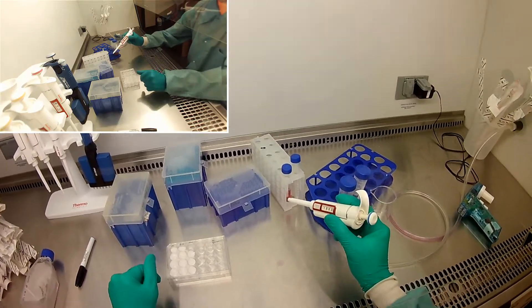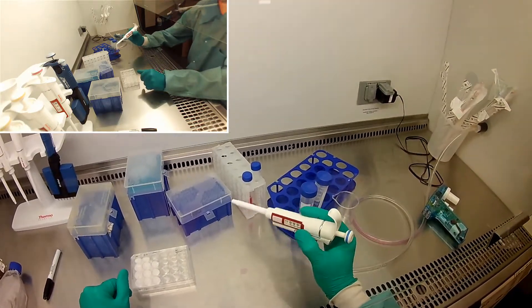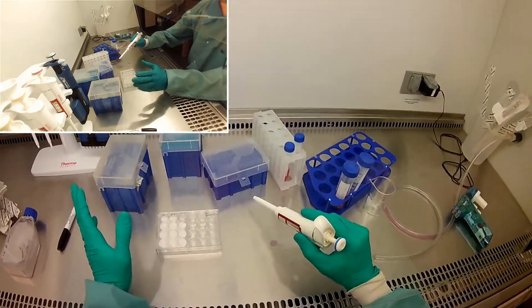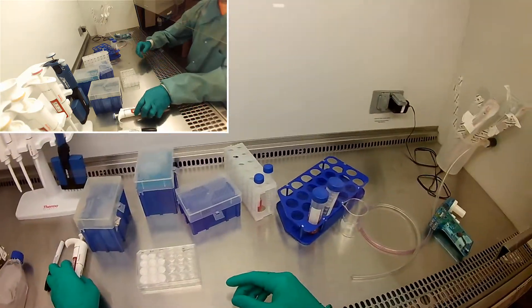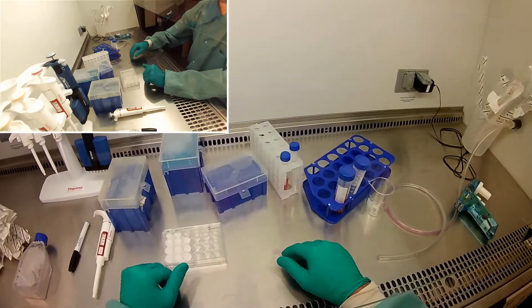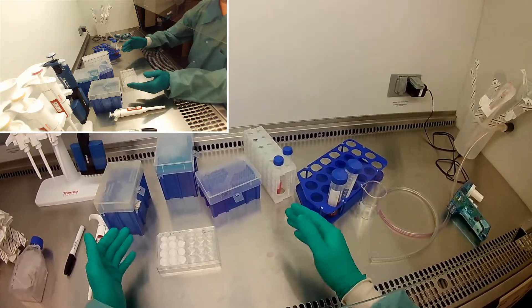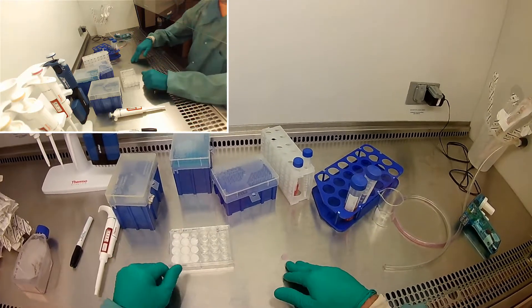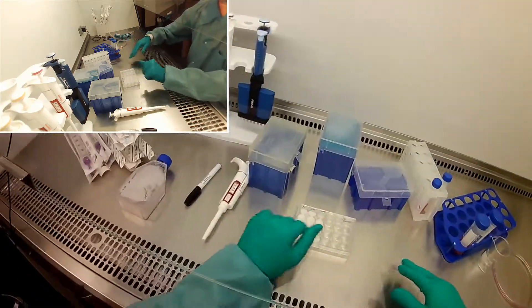Right, so instead of trying to do like 1.03 mils, I'm just going to have one mil of the cell suspension, which is about 145,000 cells, plus 11 mils of just media. And that will take 150,000 cells and put it into 12 mils of media, which is what I want to seed down here.